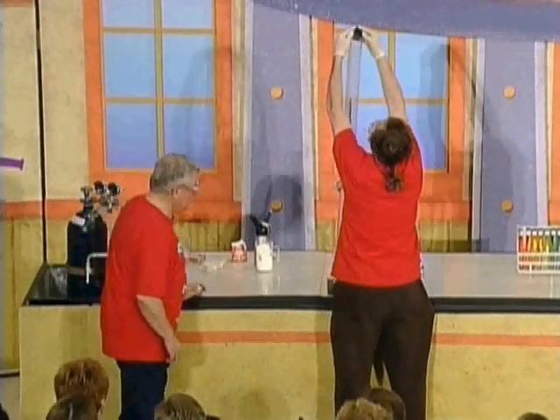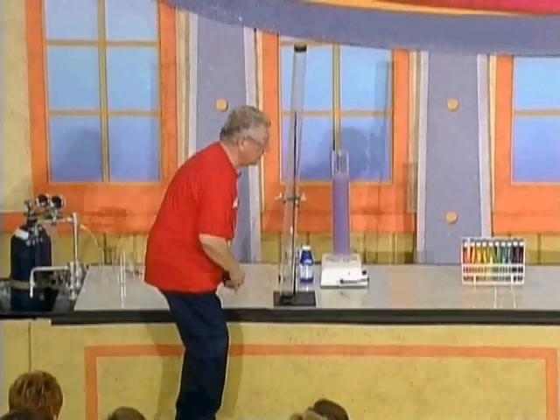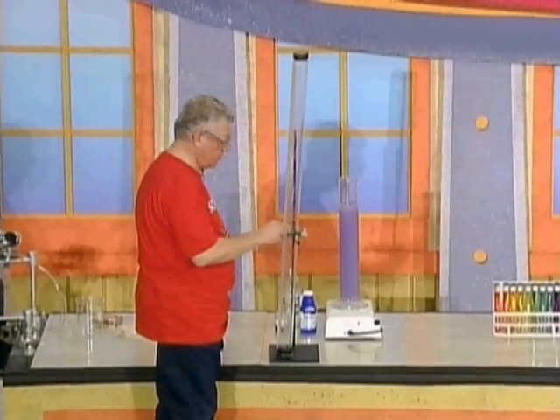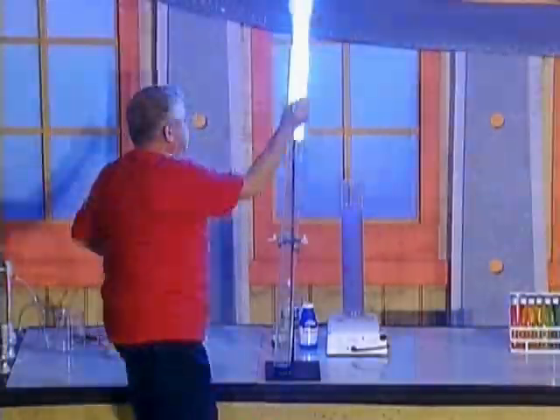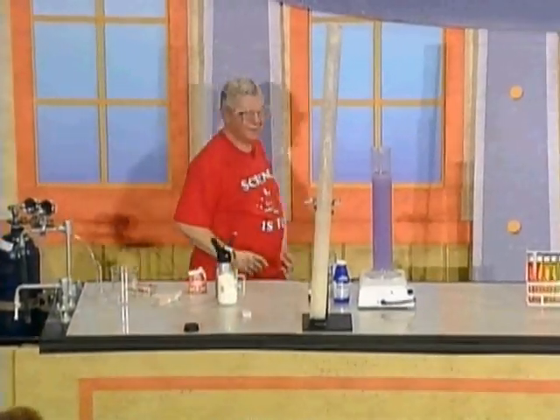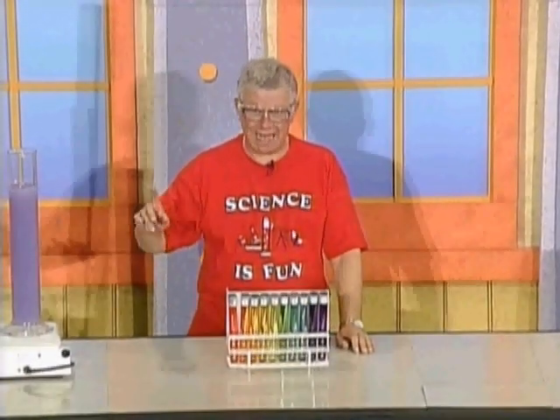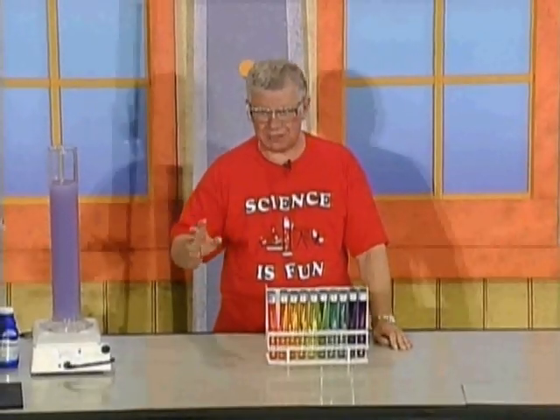I'm going to get up on this stool, light a match, and then remove the rubber stopper and drop the match in the dark. That's an example of an uncontrolled combustion reaction between nitrous oxide and carbon disulfide.